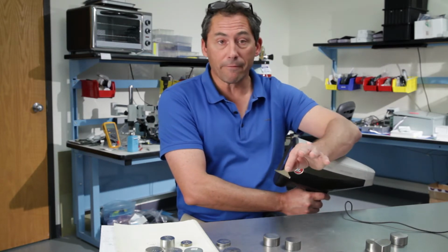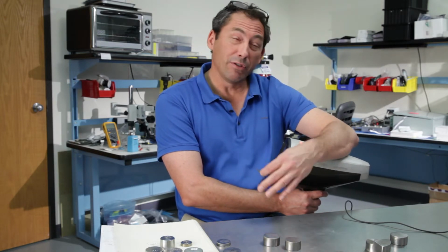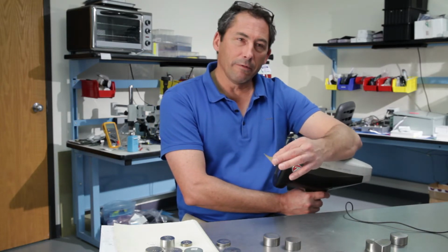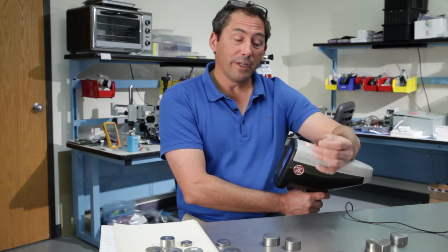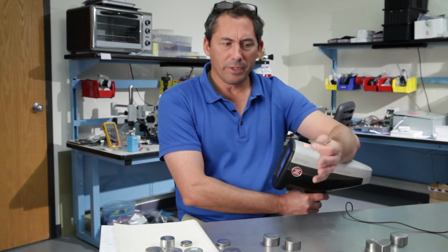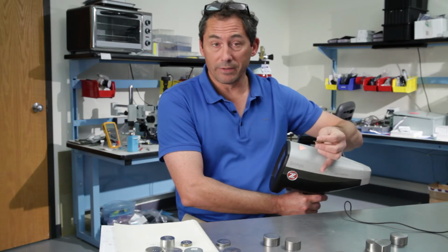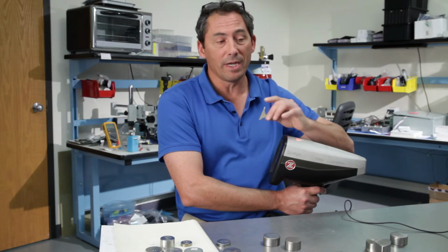Now, it doesn't quantify it because there's no calibration, but it gives you an idea if there's a lot of something or a little of something. It's so valuable, I think, especially in a recycling environment, if you get some odd material in, that you can just shoot it and at least get some idea what's in it. And if it's really an odd, unusual material, you can always calibrate. This instrument is so flexible, you can add elements, you can add calibrations, you can do everything with it.